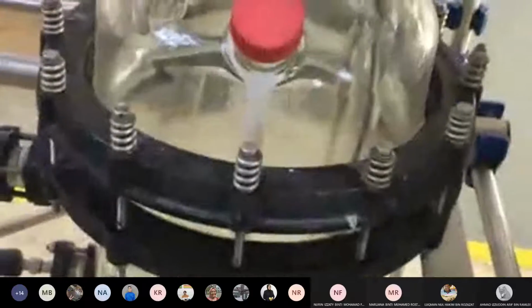Okay. So for a batch reactor, let me first explain what systems come with it. Of course the most basic is the vessel. So this is the batch reactor. Remember I told you the main difference between batch reactor and the rest of the reactors. A batch reactor is a closed system. What does closed system mean? If you notice, nothing goes in. I will only input my reactant inside here.